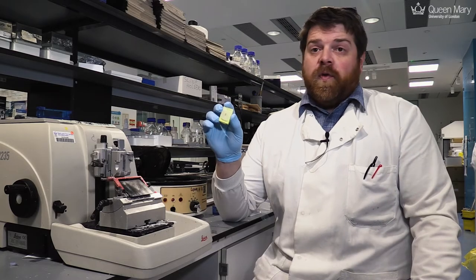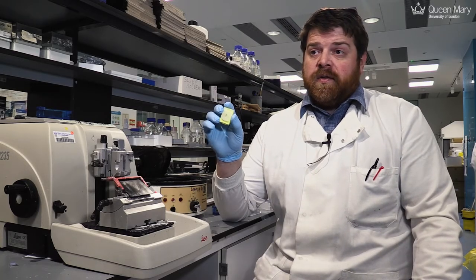We embed either organotypic skin equivalents or human skin or other tissue in paraffin wax and make these little tissue blocks. The paraffin wax holds the tissue in shape in the right place and allows us to cut sections from it.